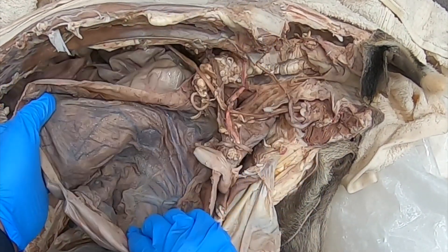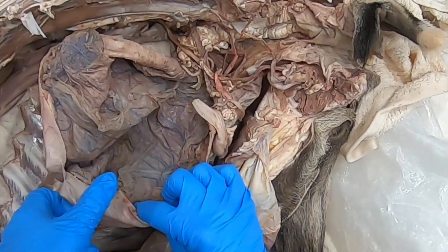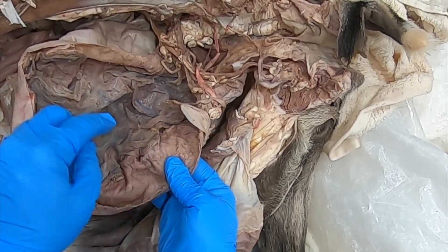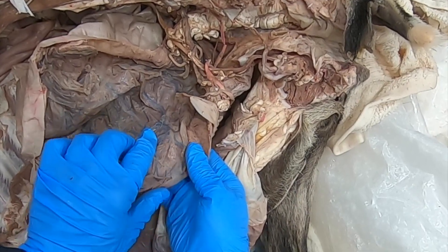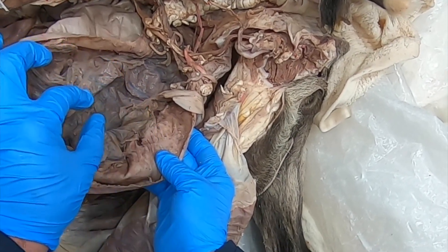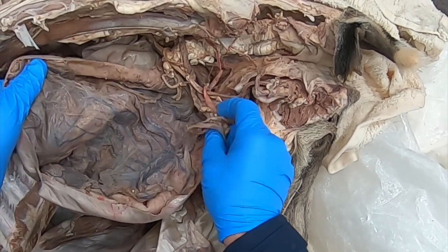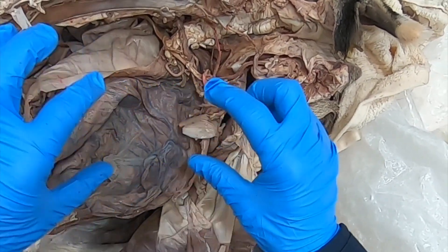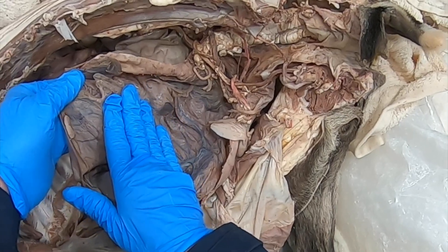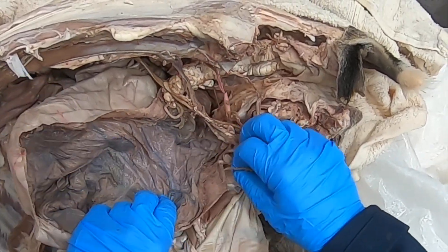We've opened up the uterus and you can see the placenta — these are the fetal membranes. With ruminants, in the uterus there are structures called caruncles, and the fetal membranes have a structure called the cotyledon that sits onto the caruncle. Each of these little units is called a placentone. So these are cotyledonary-type placentas, whereas in dogs and cats they have a zone around the middle so they're zonary, and in horses the attachment is very diffuse.